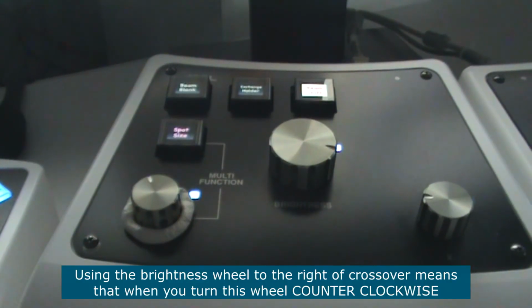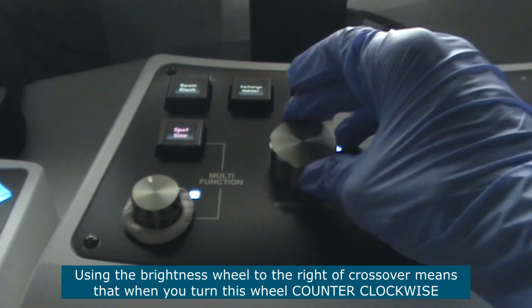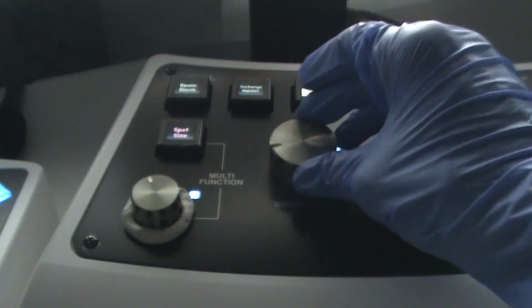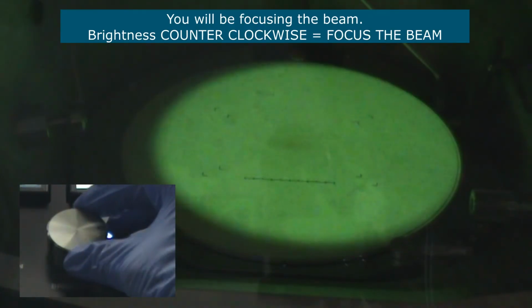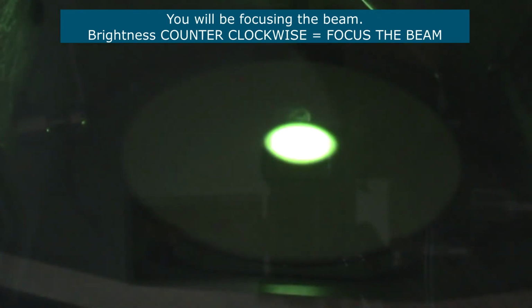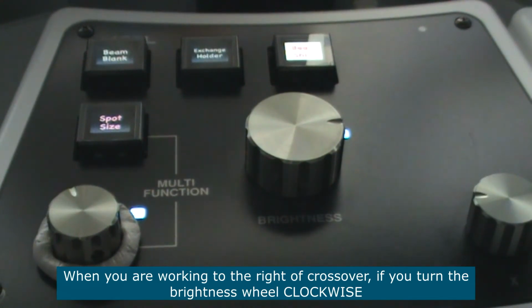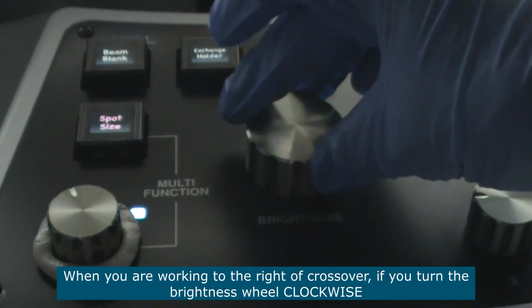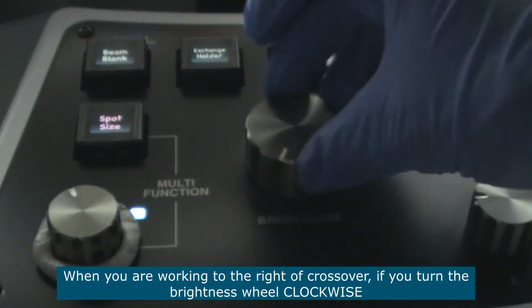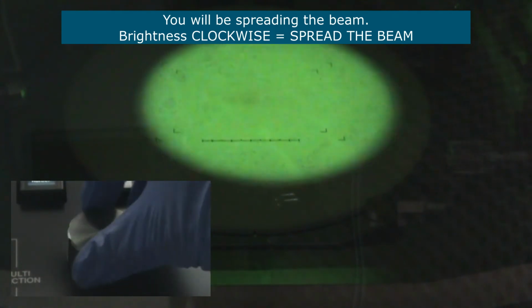Using the brightness wheel to the right of crossover means that when you turn the brightness wheel counterclockwise, you will be focusing the beam. On the other hand, if you're working to the right of crossover, when you turn the brightness wheel clockwise, you will then be spreading the beam.